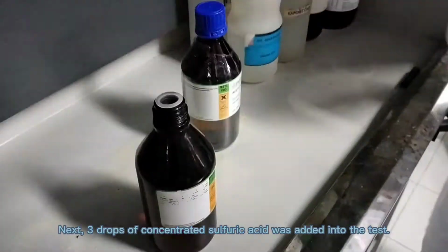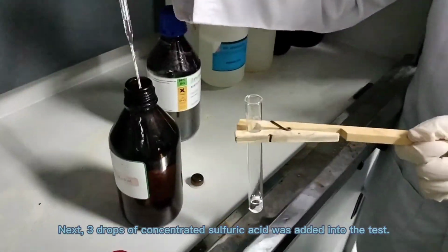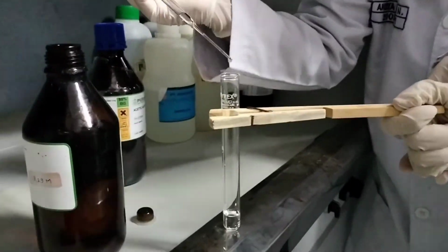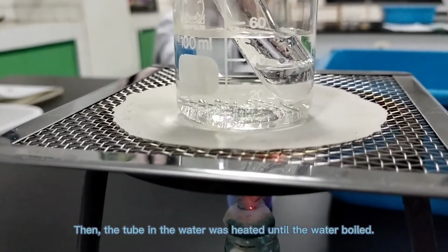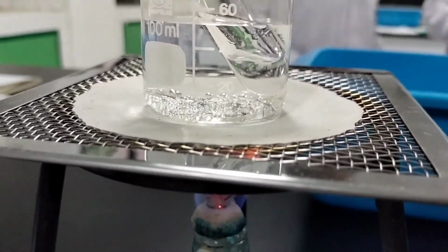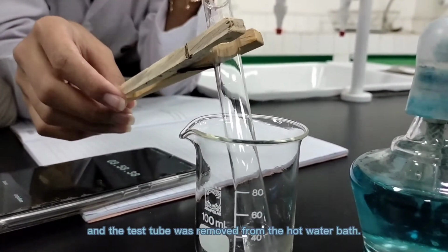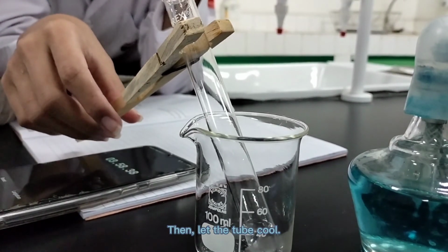Next, 3 drops of concentrated sulfuric acid was added into the test tube, then it was mixed. Then, the tube in water was heated until the water boiled. Next, the burner was turned off and the test tube was removed from the hot water bath. Then let the tube cool.